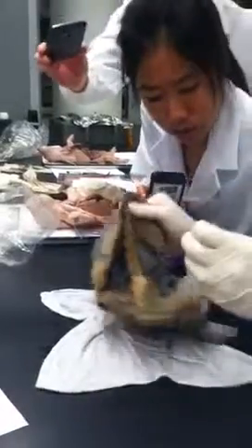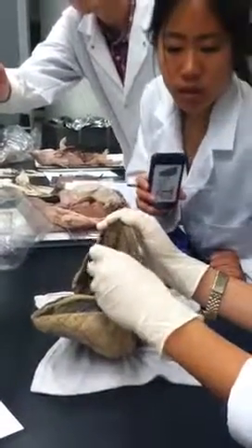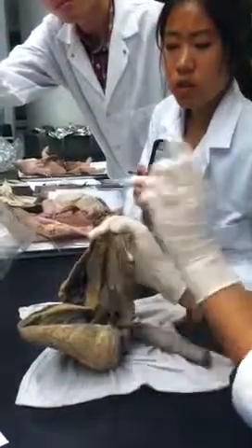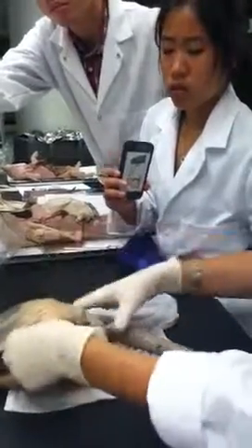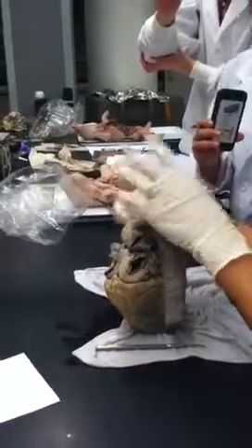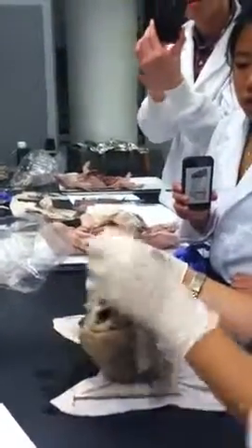Okay. So what's confusing to some people is they're like, wait, is this the atrium or is this the atrium? This is the atrium, because you have the cusp right here, right? So this would be atrium, this is ventricle, and this is continuation of the ventricle up into the semilunar valve. So after it goes up into the semilunar valve, then it comes out through these two guys, right? Are there two semilunar valves? Yeah, these are all called different things in the human, but for now, the one that's coming from the right ventricle and the one that's coming from the left ventricle, they're both called semilunar valve.